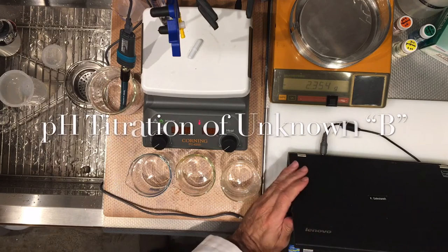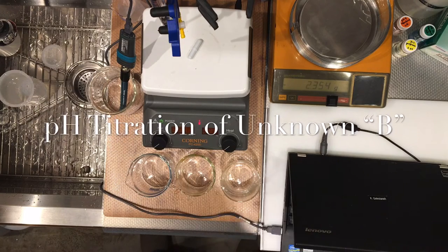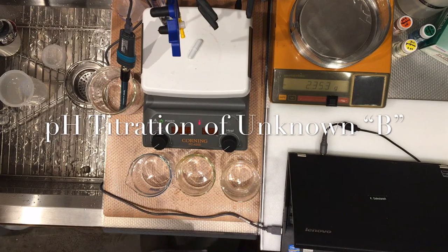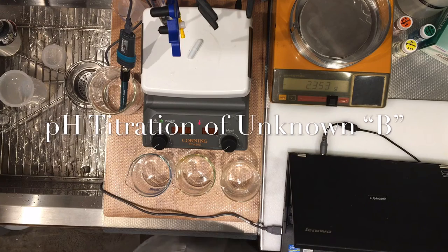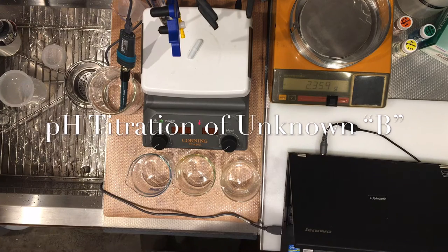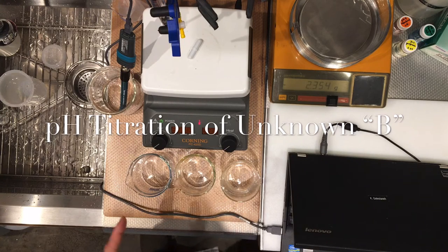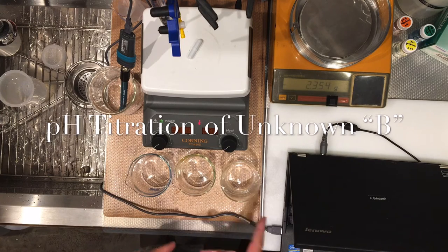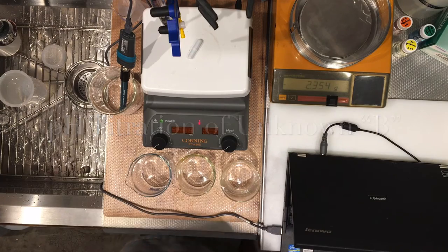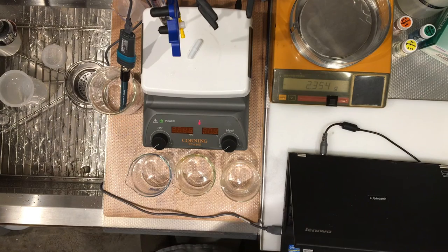Hi, everyone. This is Professor Golastani. I'm showing you the process of pH titration, and we're going to weigh out a certain mass of an unknown acid, let's call it unknown acid B.